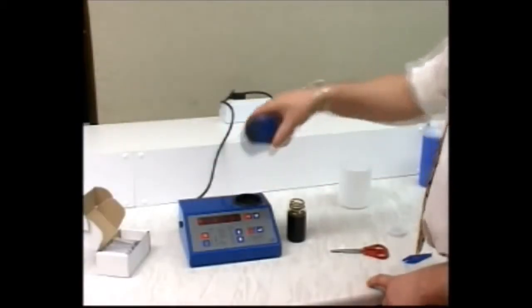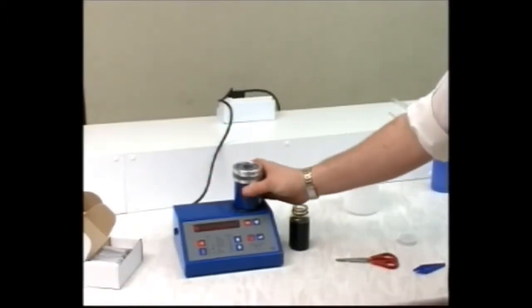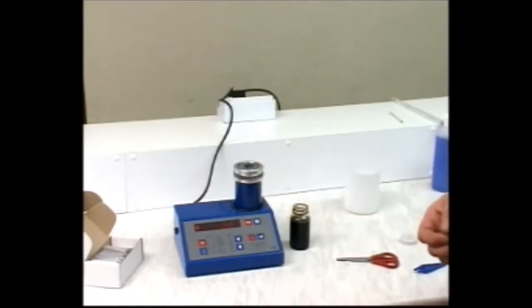Remove the cell and shake it until the display reaches 120, then replace it on the unit. You must shake it thoroughly or the test won't work.